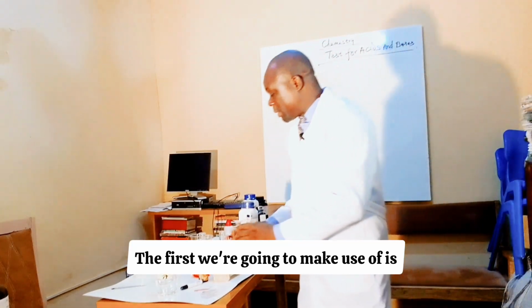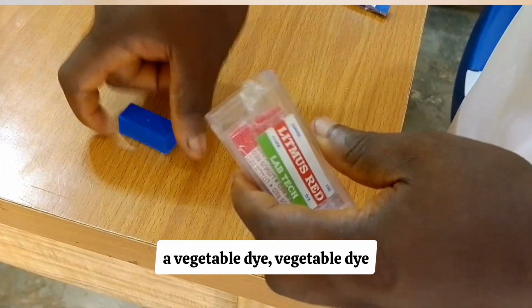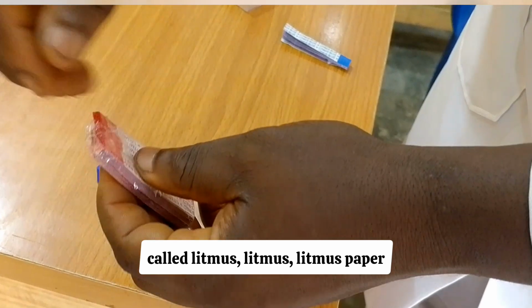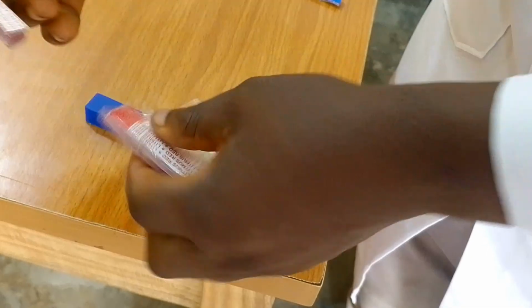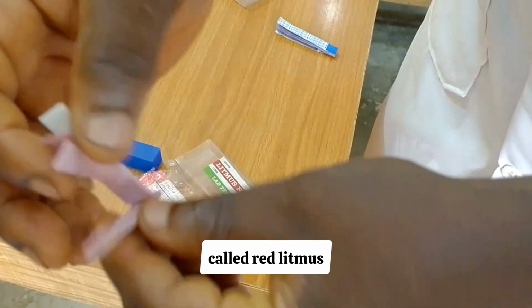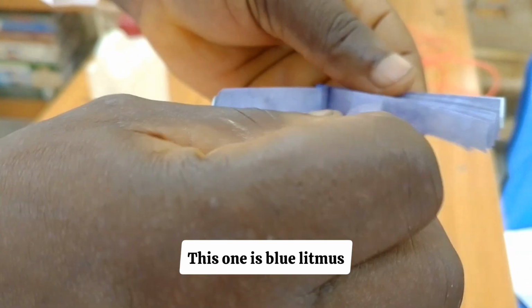The first we're going to make use of is a vegetable dye called litmus paper. They are formed from vegetable dyes. They are from the plants. Now, one is called red litmus. This is red in color. This is red litmus. This one is blue litmus.